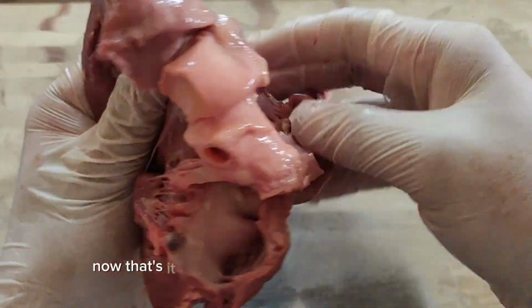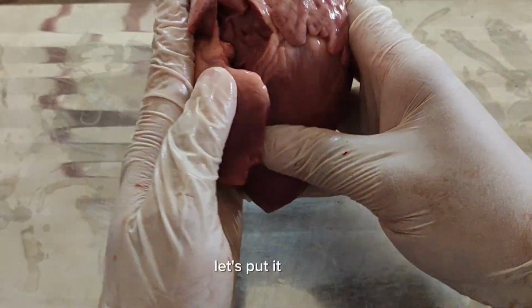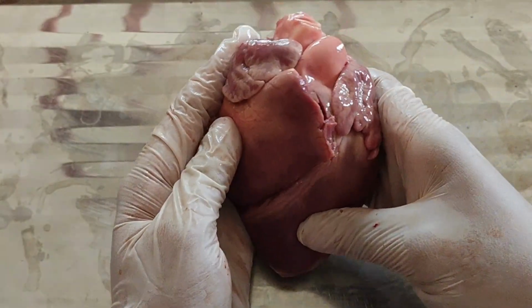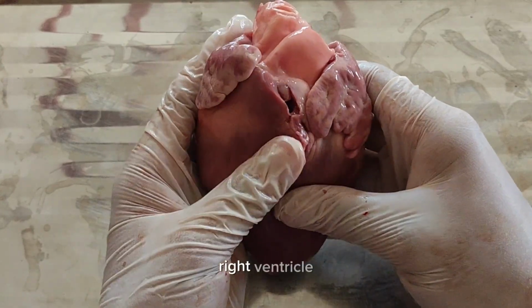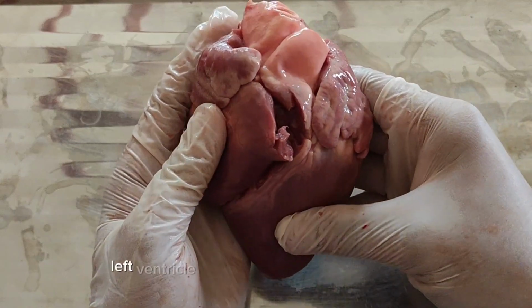Now, that's it for the heart. Let us have a recap again. Let's put it back. There we go. Again, everyone, this is our heart. This is our right atrium, right ventricle, left atrium, left ventricle.